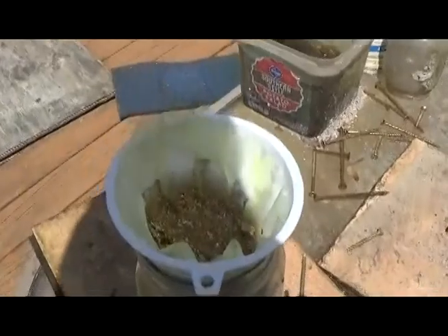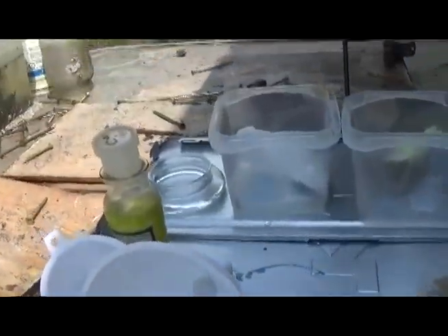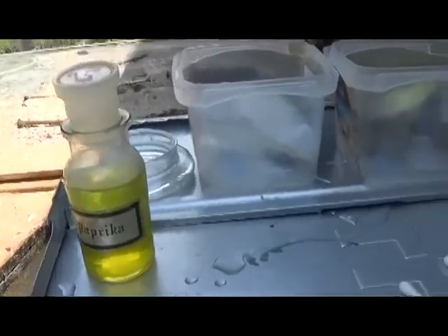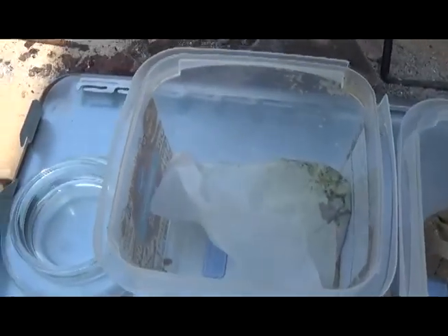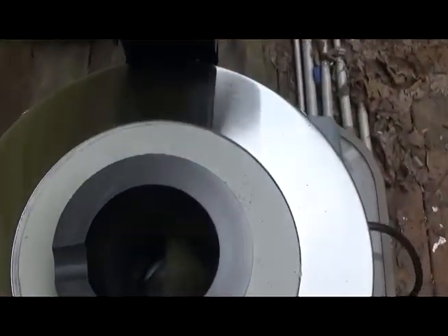We're back. We'll take this filter paper down and dump it. This one here we'll gather up and put in the bin. Alright, so we have our little bottle of gold — labeled and ready. There's what's going in the furnace; this other material is just going into our collection. Where the gold is in there — this is the first light-off of this thing.